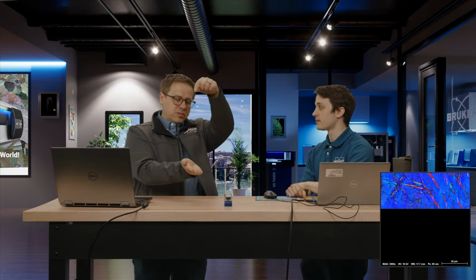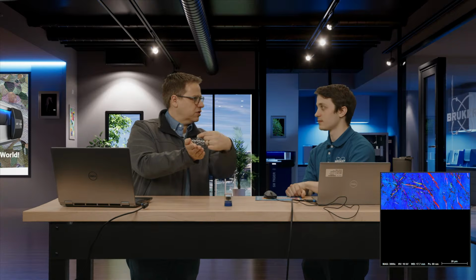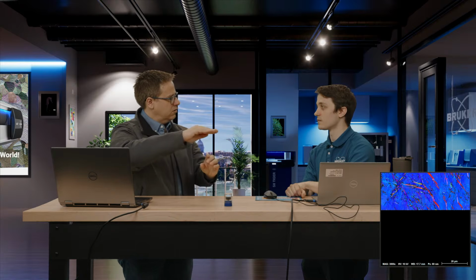All right, great. So electron beam comes in, hits the sample, and we get cones of electron diffraction coming off. Yes. And then the intersection of the cone with the detector gives us a line? Well, I think of it as a cloud of electrons, right? There's going to be a point of highest saturation. You want to get that set up such that it is reaching the detector. And from there, that cloud of electrons is going to produce a series of patterns called Kikuchi diffraction patterns. And we can index the zone axes, so wherever those bands are aligning on top of each other, to determine what is the orientation of a given crystal in our sample.